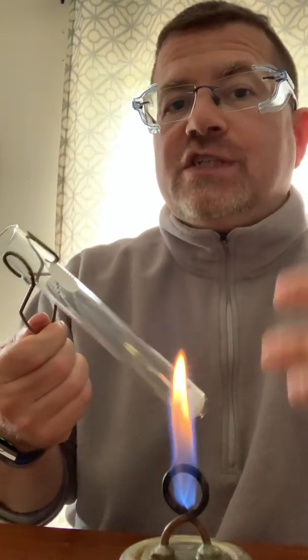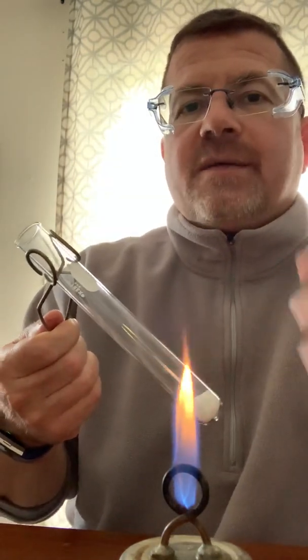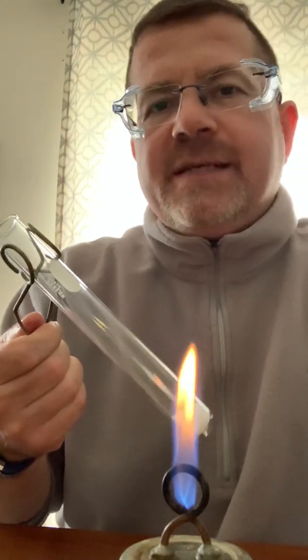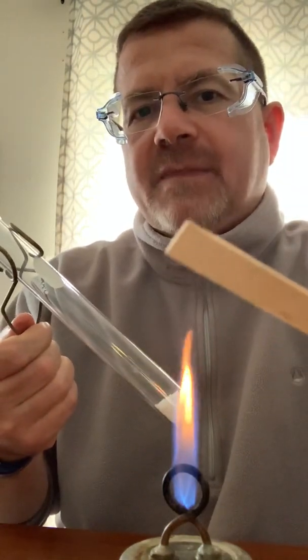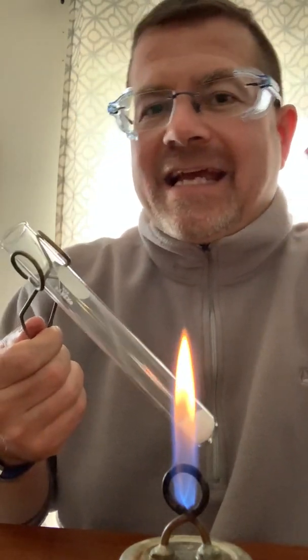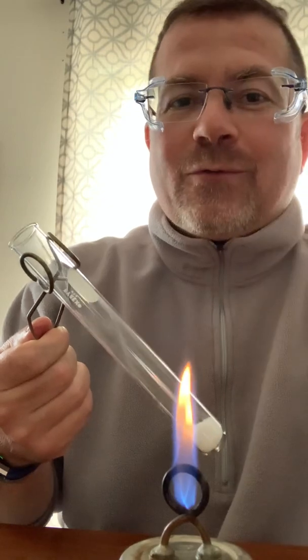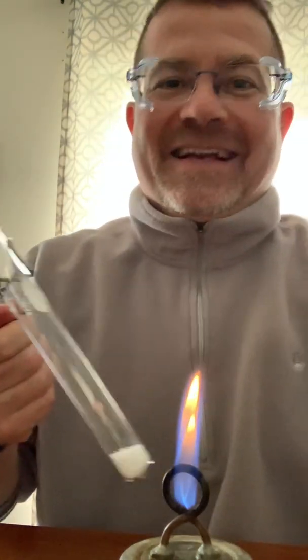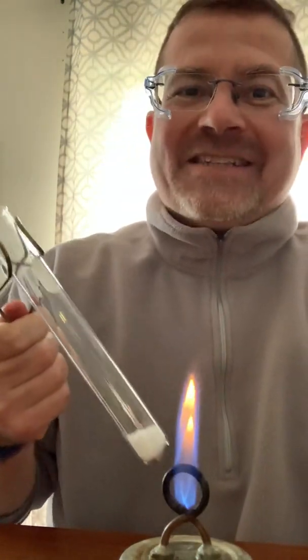Anytime you're doing anything with a test tube safety-wise, you don't want to point it at somebody or at yourself. So the test tube is going to be pointed over there. All I'm going to do is heat up this potassium chlorate, and when I add energy to it, it's going to start making a sound — it'll sound almost like snapping and crackling and popping, kind of like you hear with Rice Krispies cereal. And when that starts to happen, you'll see me light this wood splint. I'll blow it out, put it back in, and you get to see that it will relight. Hopefully it'll be fun, so here we go.